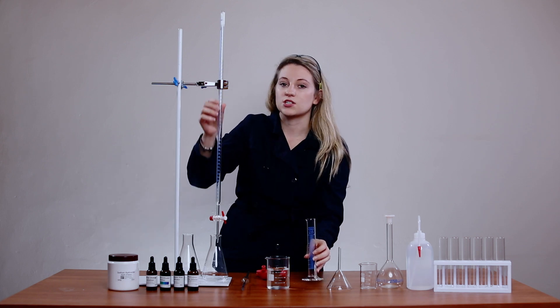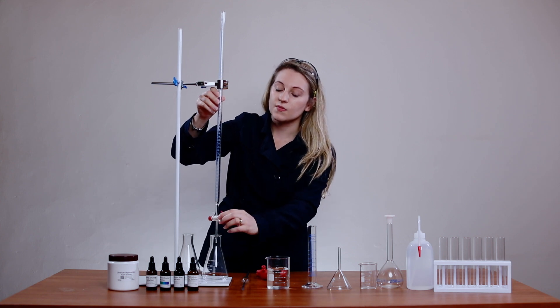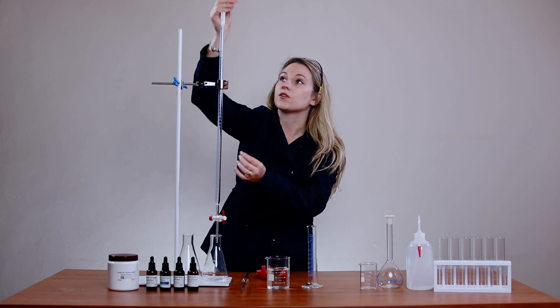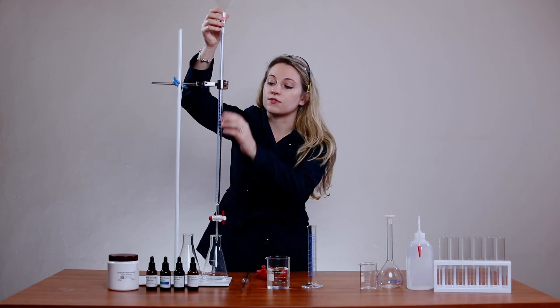Using a burette for titration is really nice and I will show you guys exactly how to work the tap and how to use a funnel to put your acid or your base or whatever you are titrating with inside of your burette.